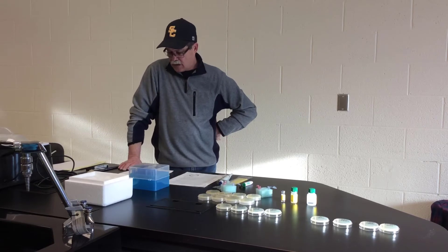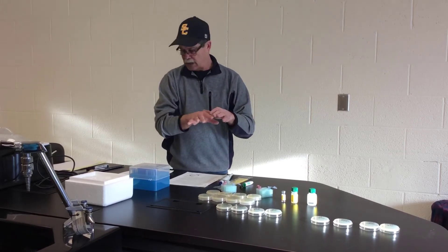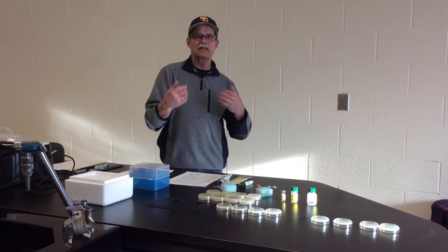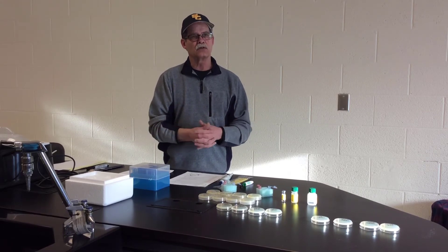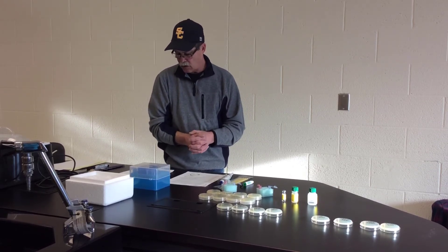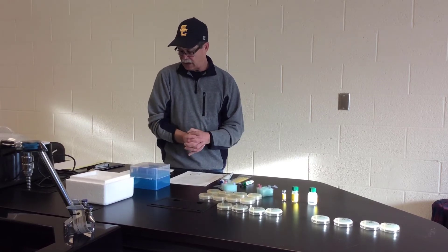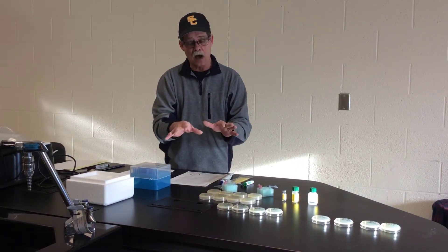Following bacterial transformation, we will select for transformed bacteria — these transformed colonies with the pGLO DNA — by growth on ampicillin-containing plates. If the plasmid has been taken up, those genes will provide ampicillin resistance to the E. coli. When pGLO-transformed cells are grown in nutrient medium containing arabinose, they will fluoresce green. GFP expression is stimulated and the bacteria will glow green when exposed to UV light.